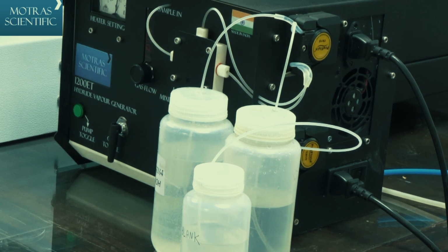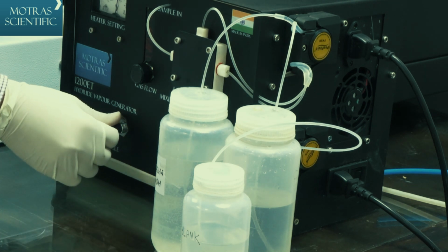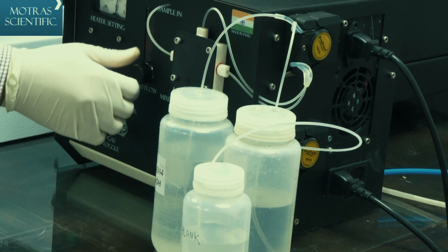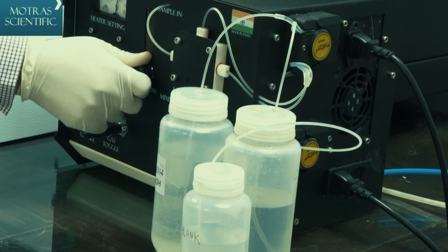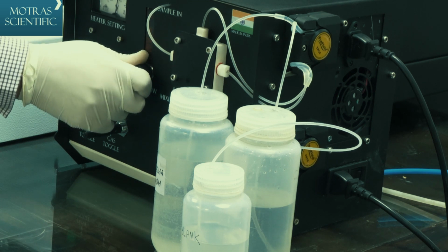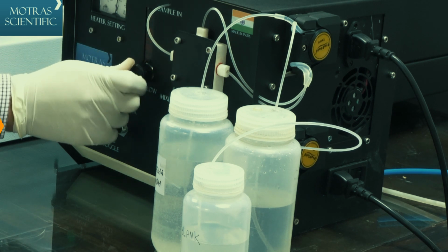As the cell is heated, there is a rise in absorption. This is due to background and heat wave produced within the cell. However, once the cell is saturated, the rise in absorption will stop and the system will reach equilibrium. Once equilibrium is achieved, argon is enabled and purged with flow rate to compensate for the heat wave generation.